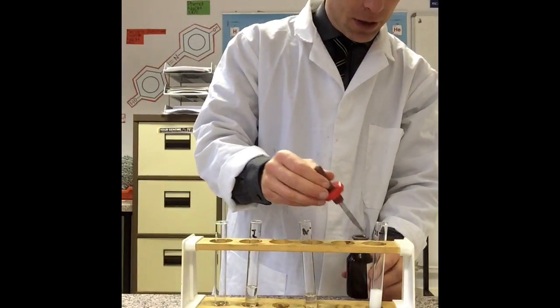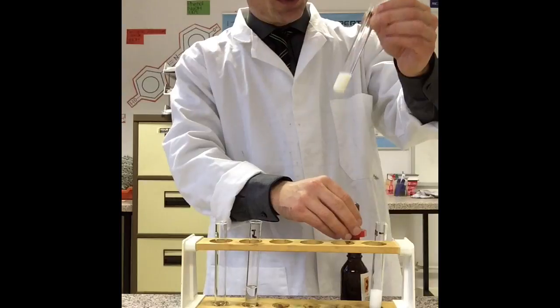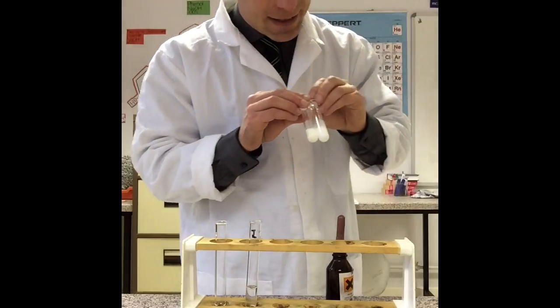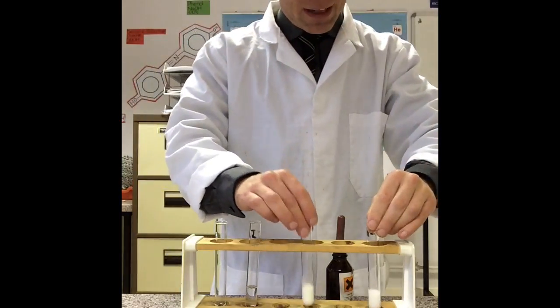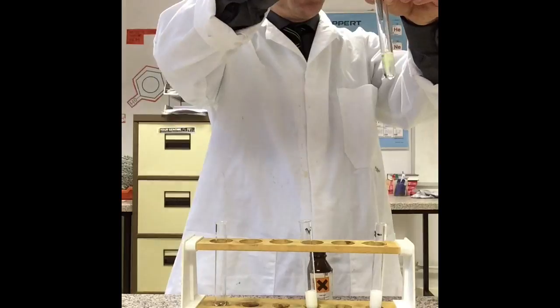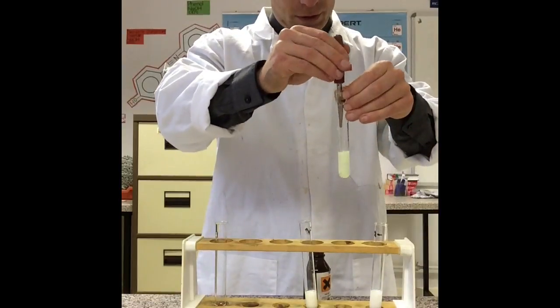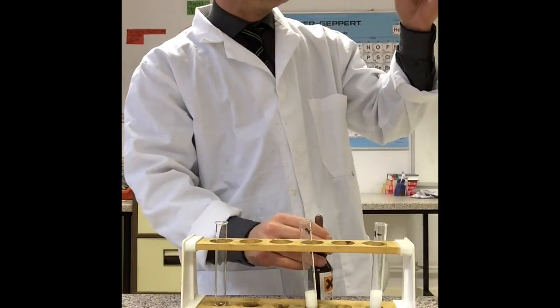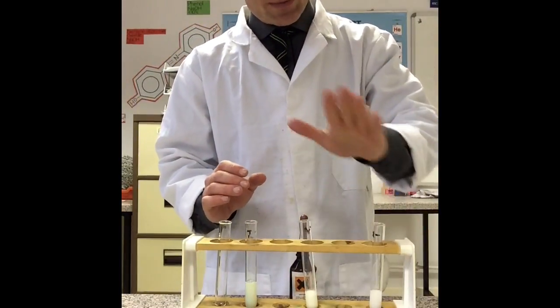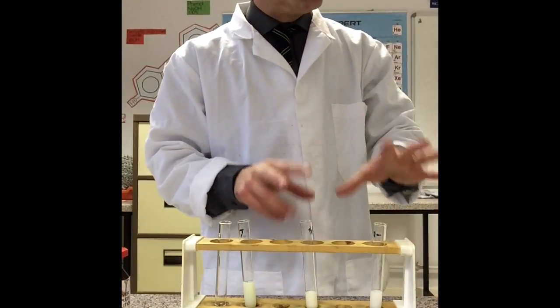Let's do bromide — I have a squirt into my bromide. That's quite difficult, but what do you reckon we're going to call that colour? Cream — yeah, cream precipitate. It is different; you can see the difference, that's very much whiter. That's cream. And then iodide — that is a yellow precipitate. So we have a white precipitate, a cream precipitate, and a yellow precipitate.